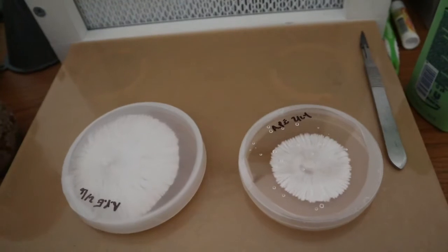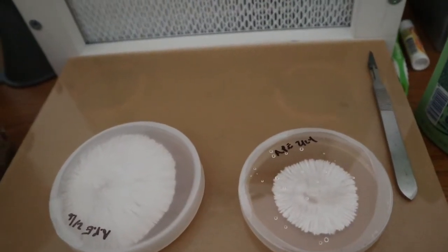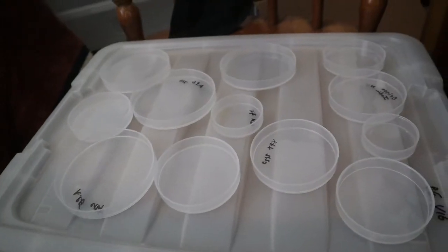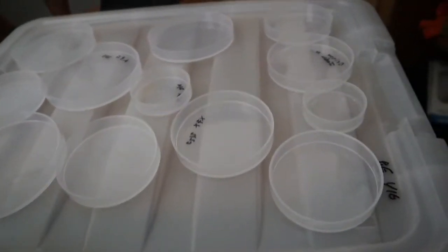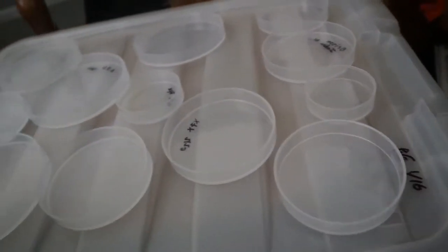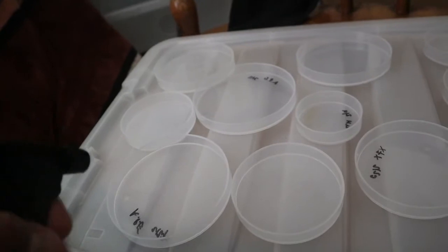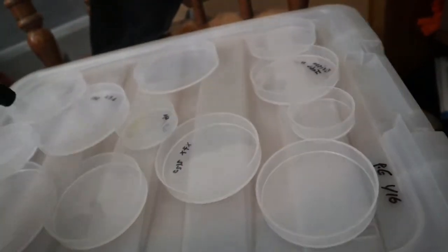Alright, so right now I'm going to show you guys how I, not prepare, basically clean them and reuse them. Alright, so here with me I have some dishes that were done or I had contaminated inside of them. So what I do is I get a spray bottle.